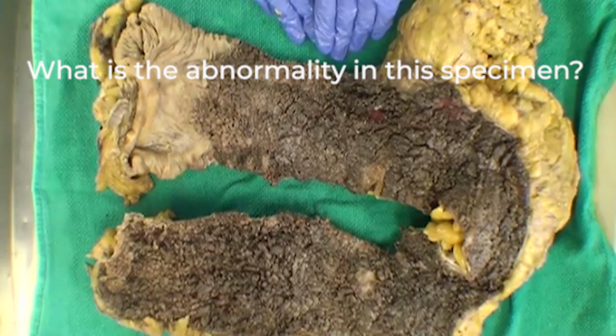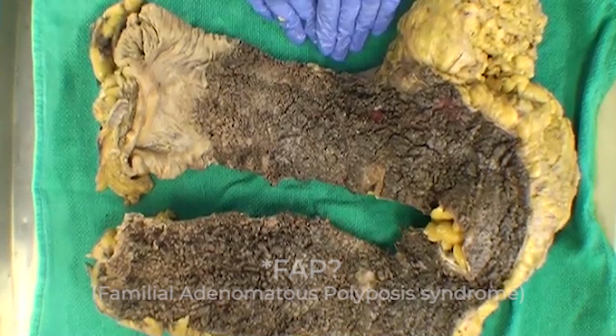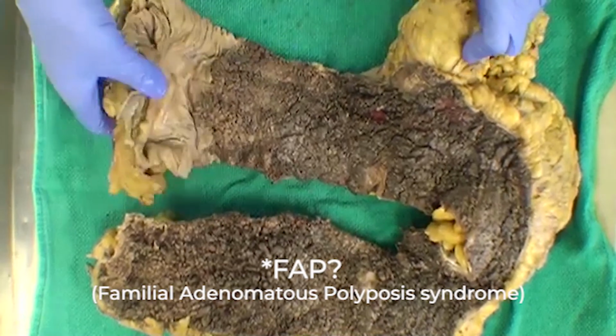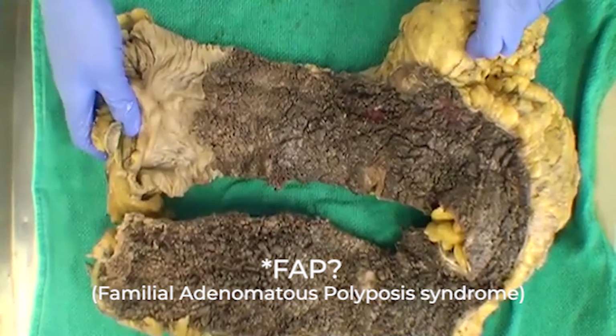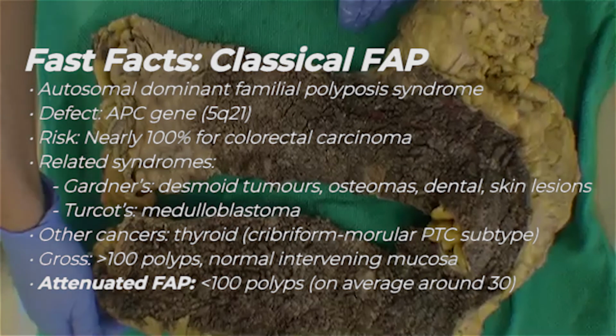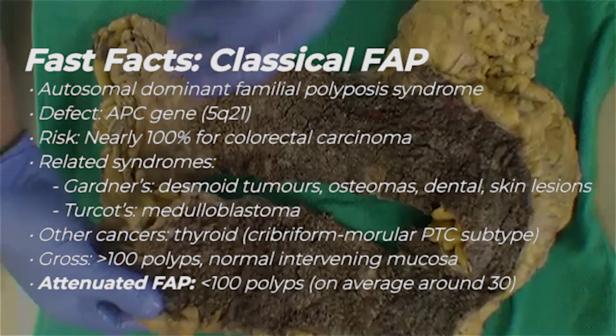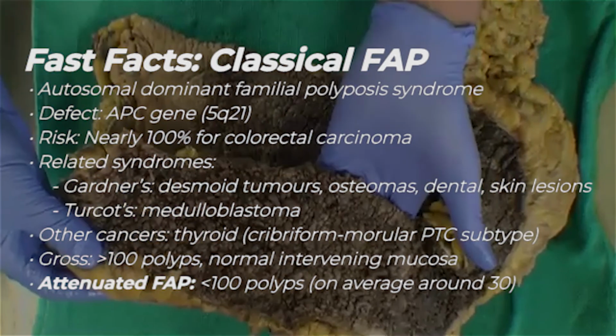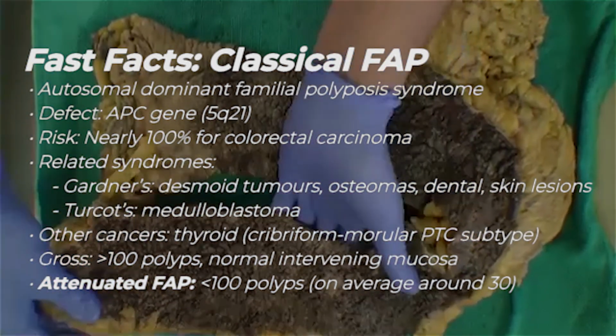Okay, so we have one person who said FAP, so that's certainly a good thought. For everyone, FAP is familial adenomatous polyposis, which is a syndrome resulting in numerous colonic polyps. If we look here, we do have something going on in the colonic mucosa. It looks very ragged and sort of darker than usual and quite bumpy.